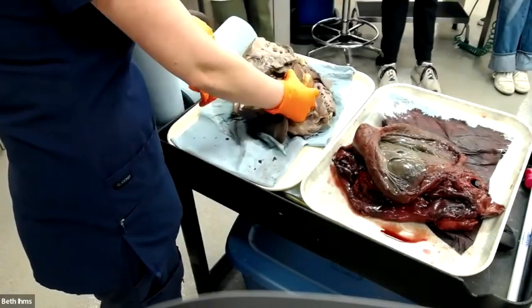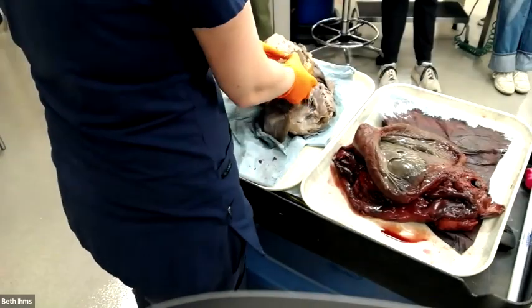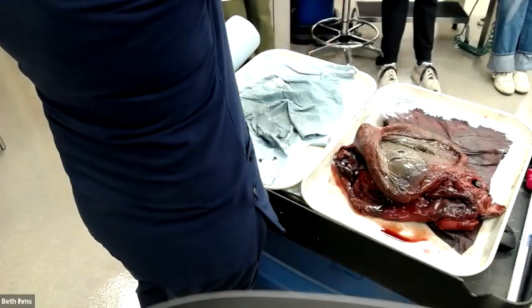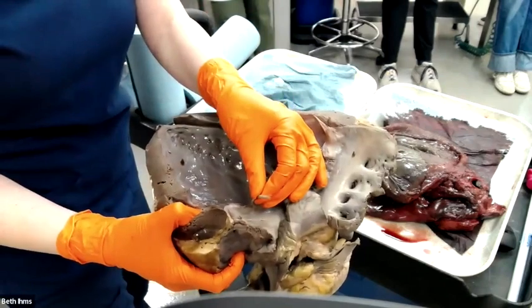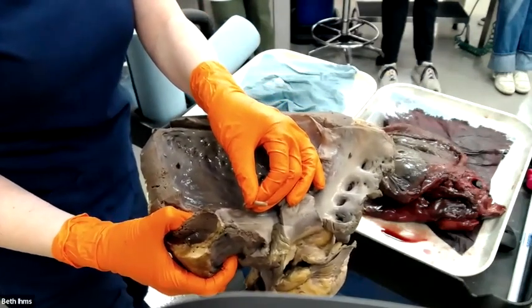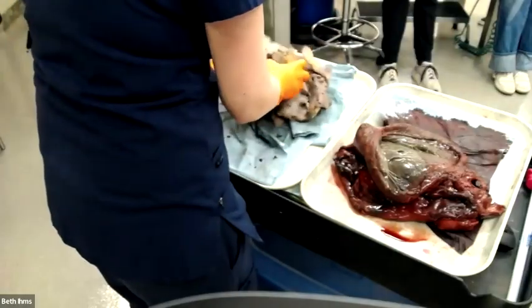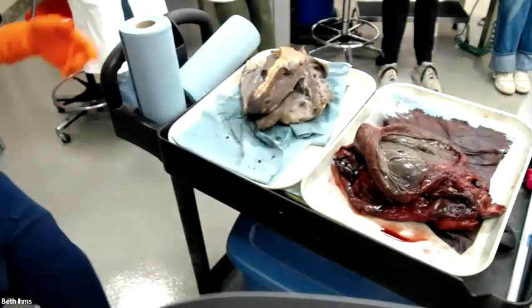This horse does have a lesion, but I didn't tell you about it because it's really subtle. This came in for a rupture of the chordae tendinae. See that chordae is frayed and skanky looking? Frayed and skanky. See it? So that ruptured. But it was subtle, so I didn't want to torment you guys with that.